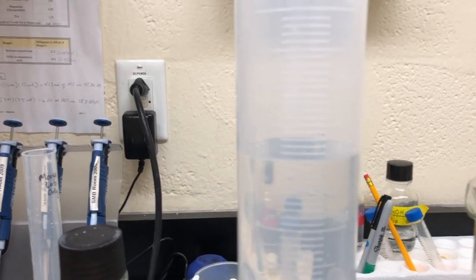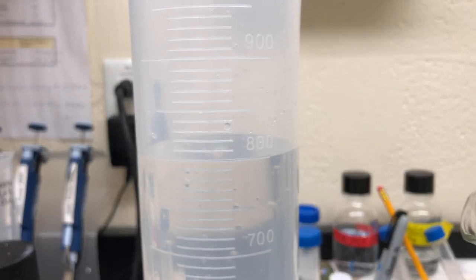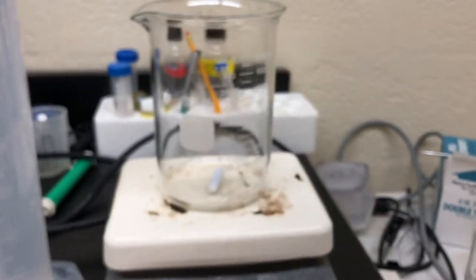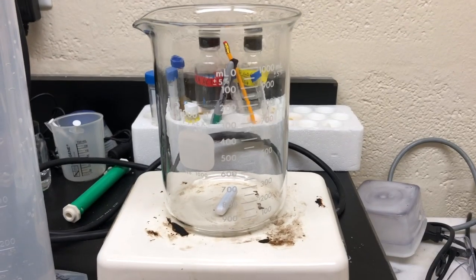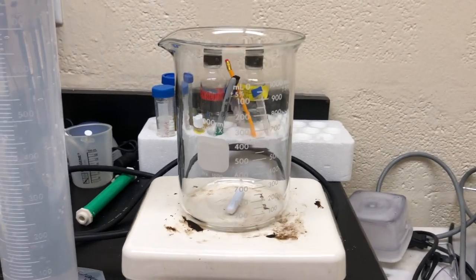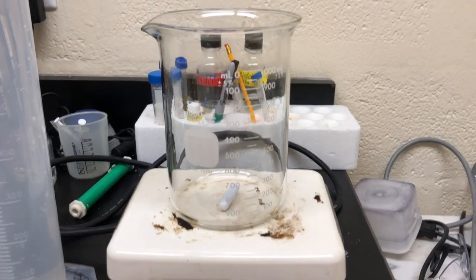So then you're going to put that 800 ml into a thousand milliliter beaker and stir the 300 grams of sucrose slowly in.